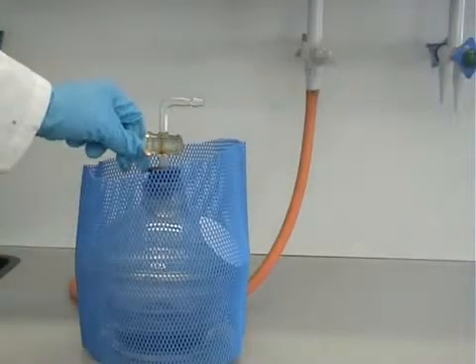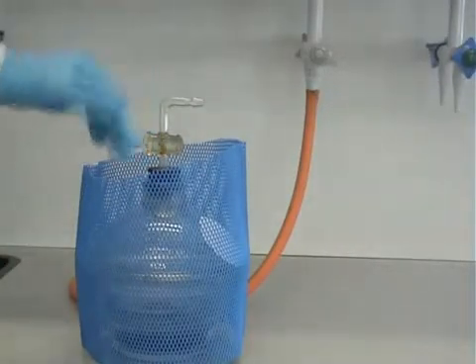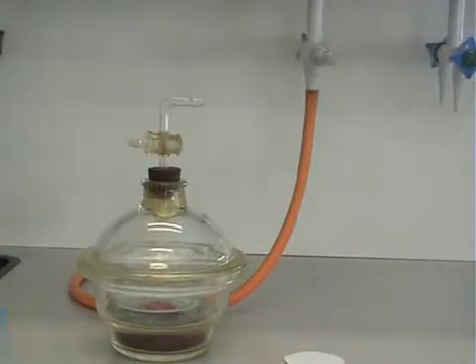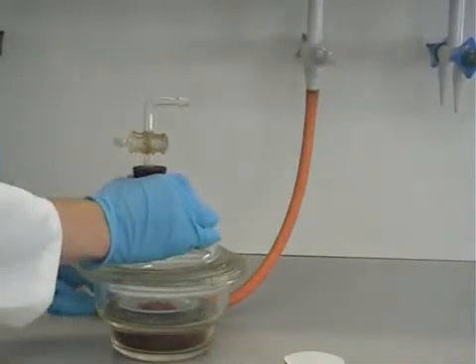Open the desiccator tap all the way. This is to ensure there is no more vacuum left in there. Remove the blue safety netting and slide the desiccator lid off.